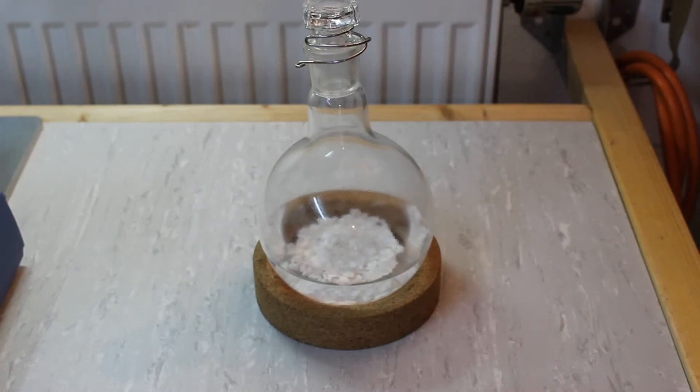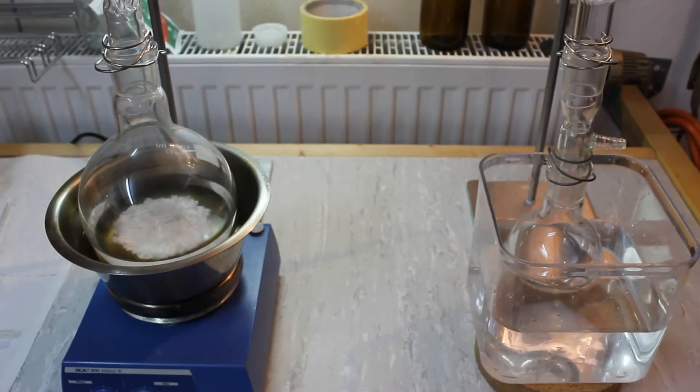Here we are the next day. The ether has been sitting over some calcium chloride during the night and now I'm going to add some fresh calcium chloride and fractionate our product. I've set up for fractional distillation of our ether product. The apparatus is basically exactly the same as before without the addition funnel. So this is just your basic boiling flask, Vigreux column, stillhead, and condenser setup.